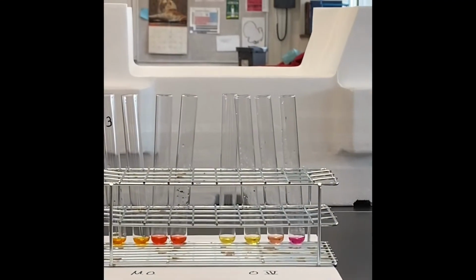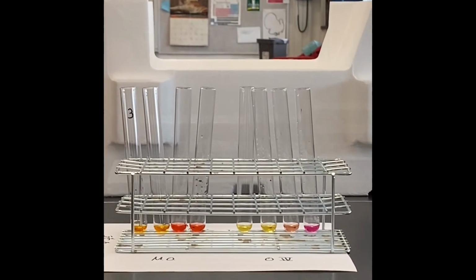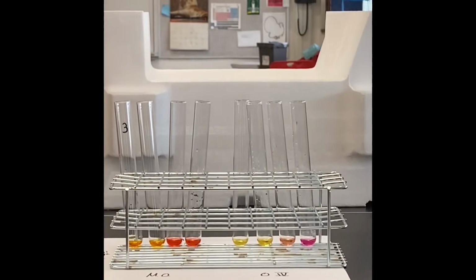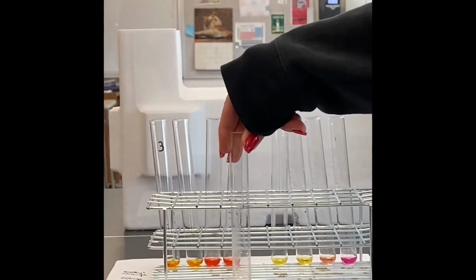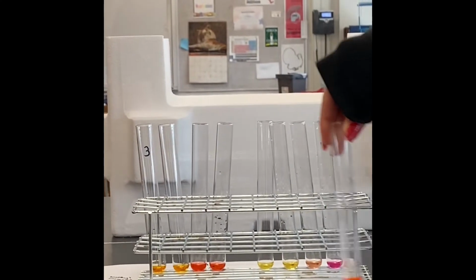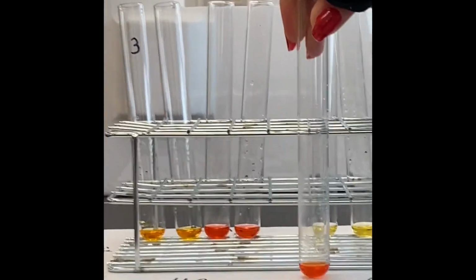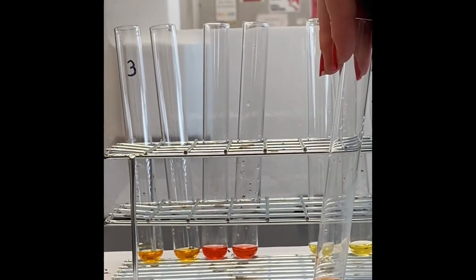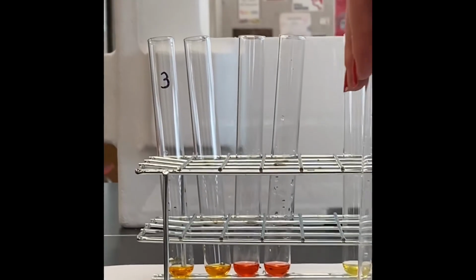All right, so now we're going to start comparing the colors of the weak acids to the colors of the strong acids. All right. This is methyl orange, 0.1 acetic acid, 0.1 molar. So the 4 on the left are the methyl orange, so those are the only 4 we have to worry about. So as you compare, you can see that it's probably in between the second and the third.